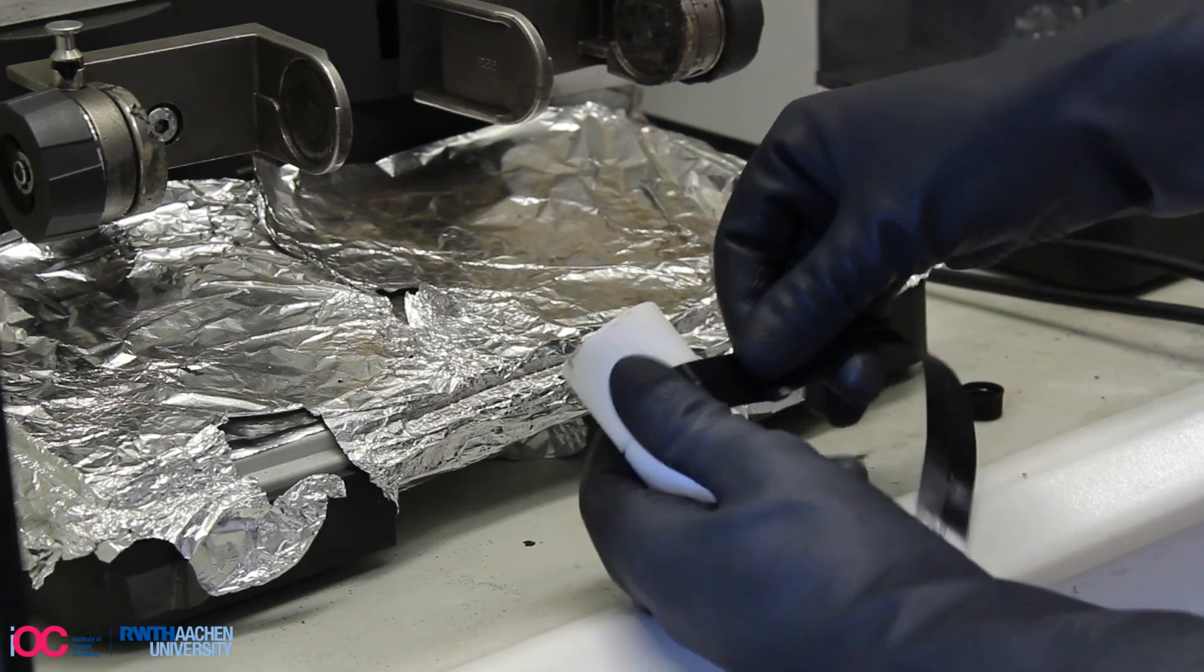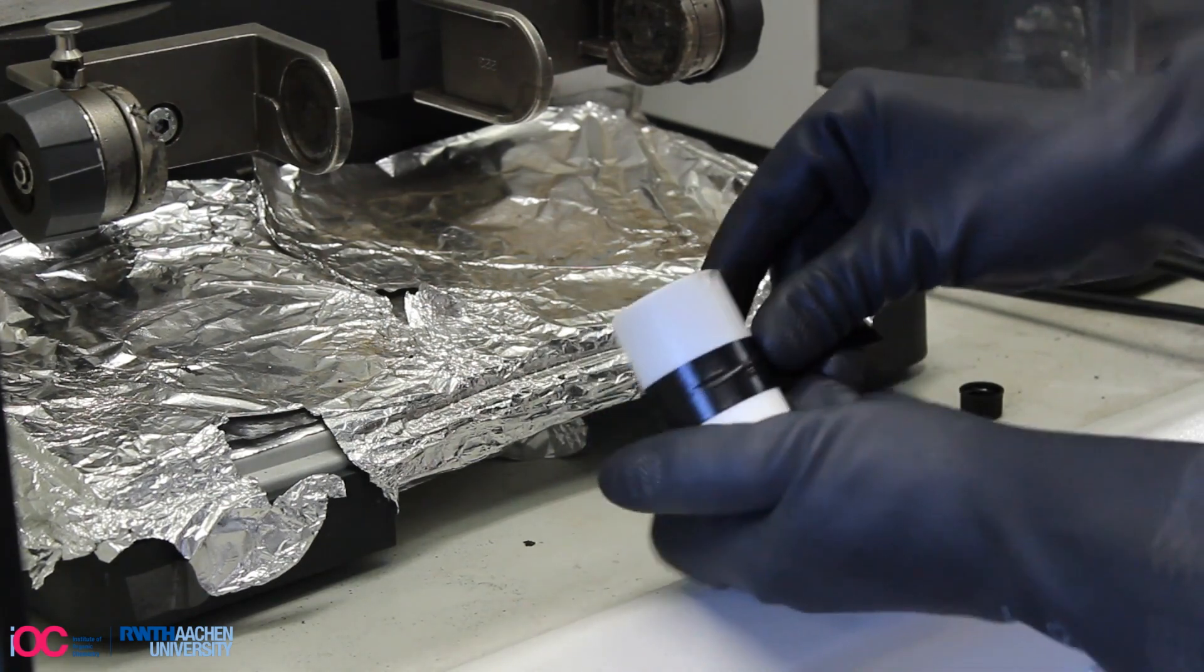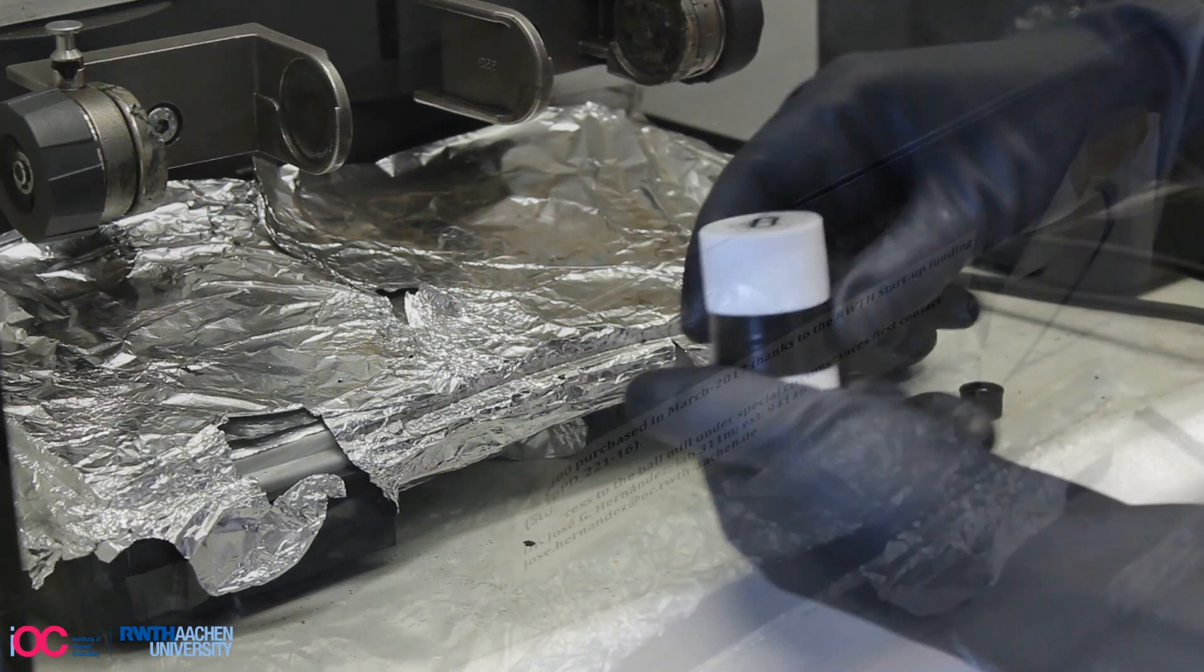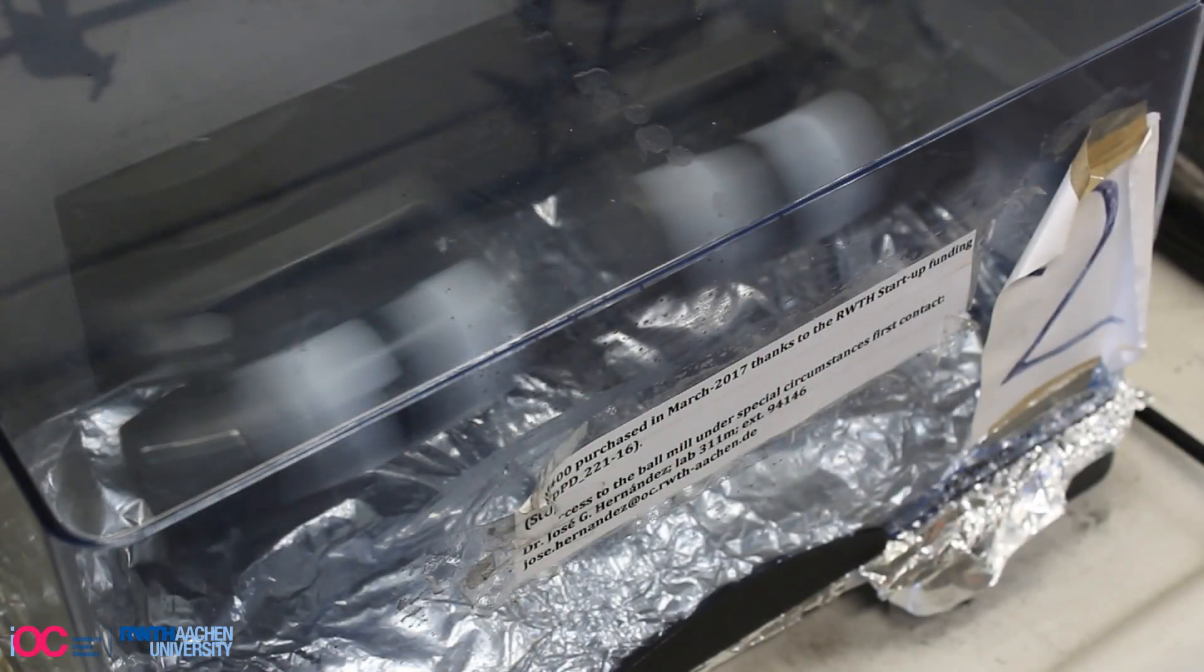Upon opening the jar, please keep it inside a fume hood. The jar is now closed, sealed again and then the reaction mixture is milled for another 5 minutes at the same frequency.